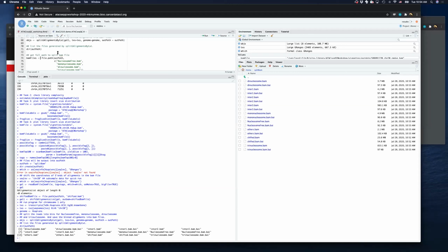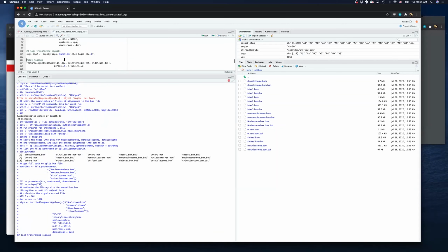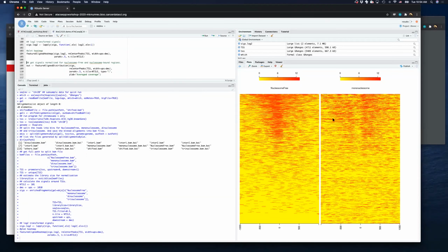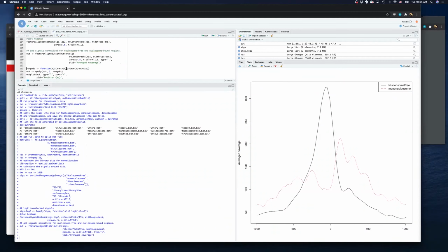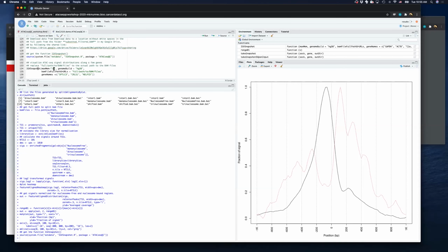Then we can do some metagene analysis. For example, we can plot the fragment distribution like this. This is just a subset. You can see the heat map for the nucleosome-free reads. This one is to repeat the figure from the Greenleaf lab. They plot the nucleosome-free reads and see the peak upstream and downstream of the transcription start site. You can see the distribution of mononucleosome, dinucleosome, and trinucleosome reads.